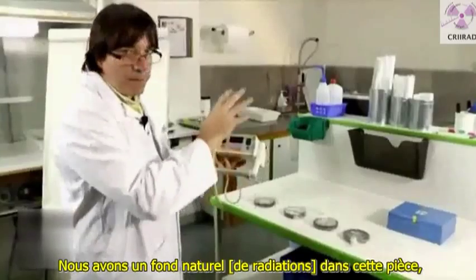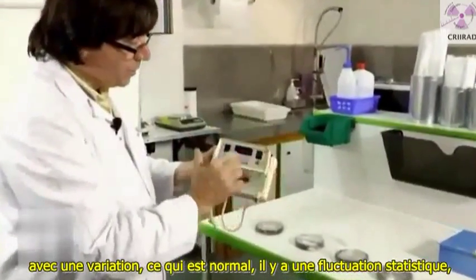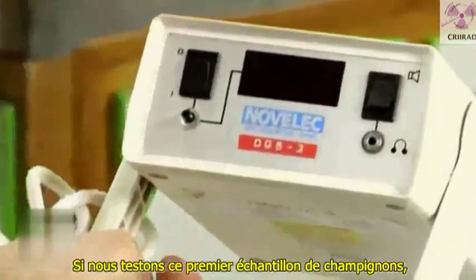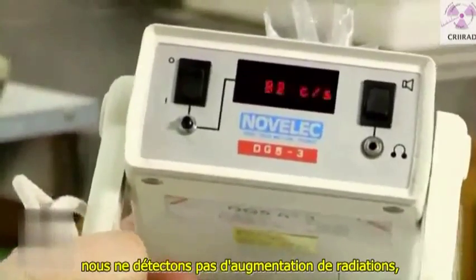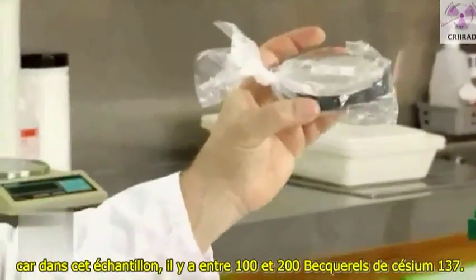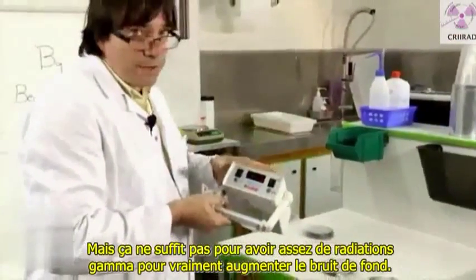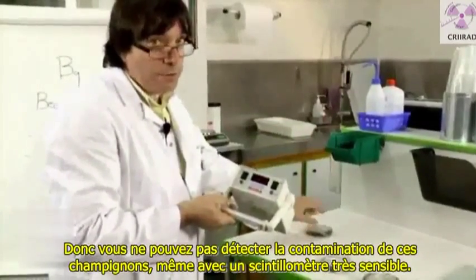We have a natural background in this room with a normal statistical fluctuation — between about 50 and 80 counts per second. If we check this first sample of mushroom, we detect no increase of radiation. Because in this sample, you have between 100 and 200 Becquerel of cesium-137, but it is not enough to produce enough gamma radiation to really increase the background. So you cannot detect the contamination of those mushrooms even with a very sensitive scintillometer.